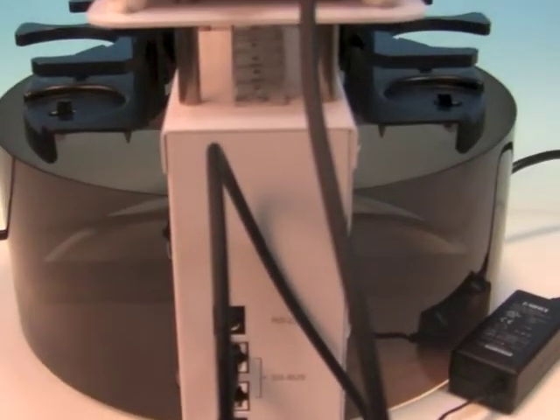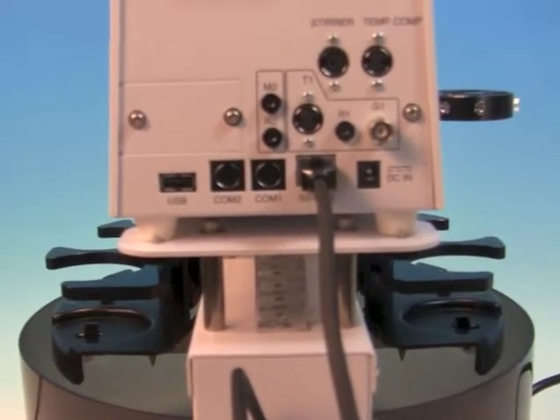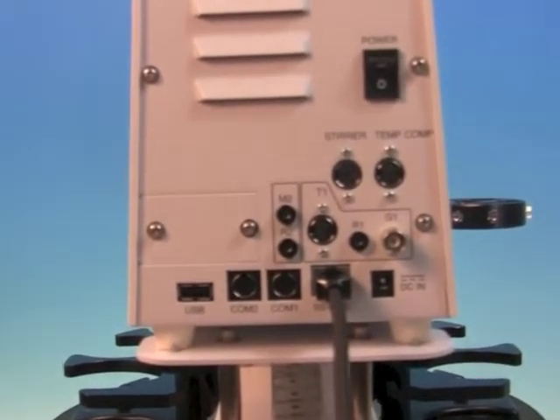The connections for the mini sample changer are also located on the rear of the sample changer and neatly connect to the preamp on the back of the titrator.